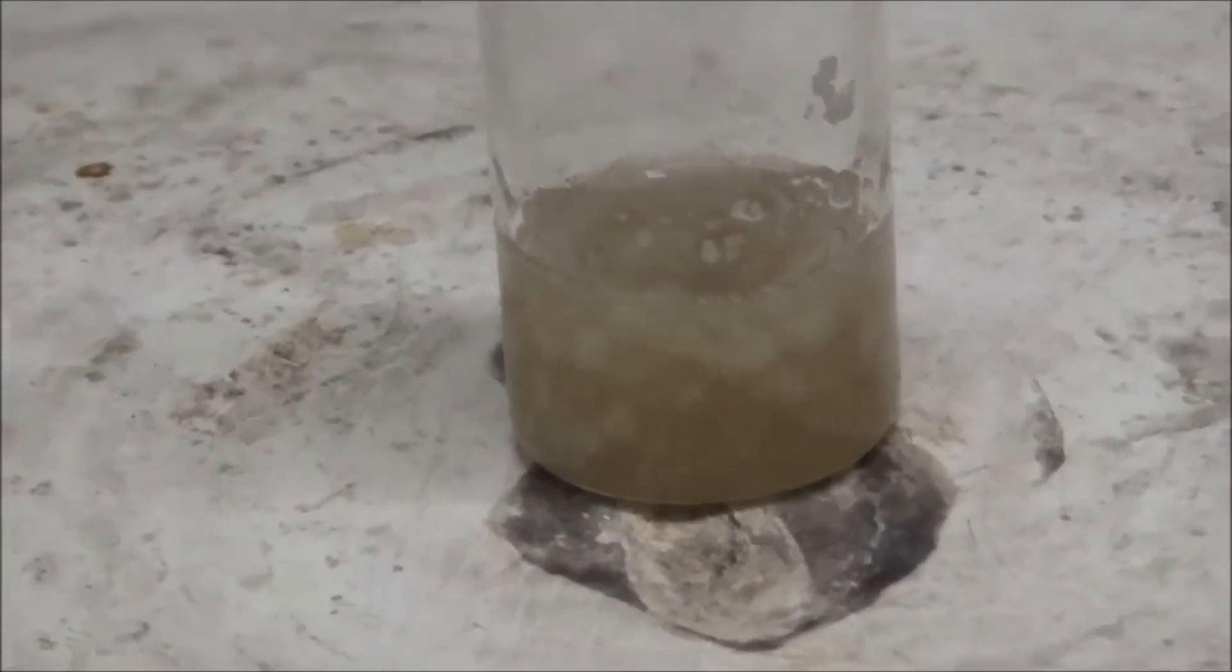Over the course of an hour nearly all of the solid melted and we were left with a completely liquid mixture.